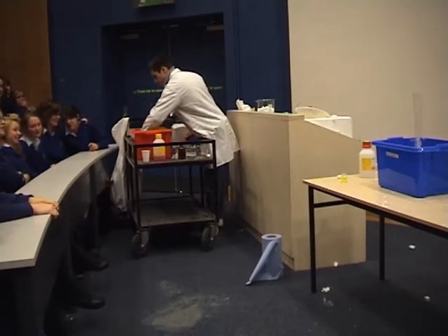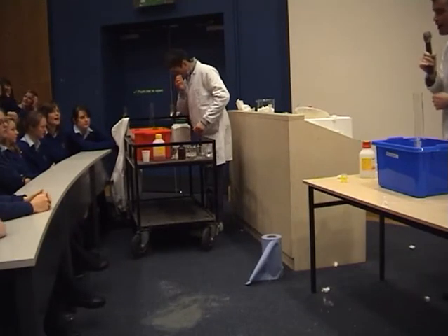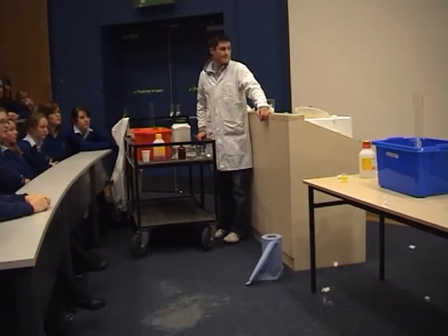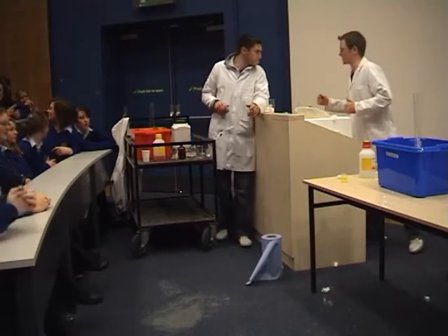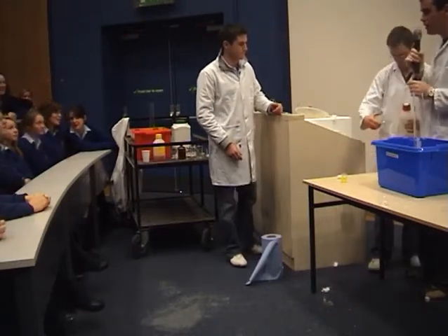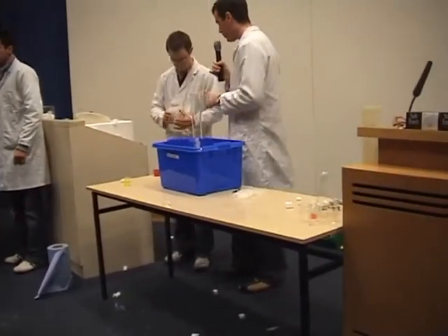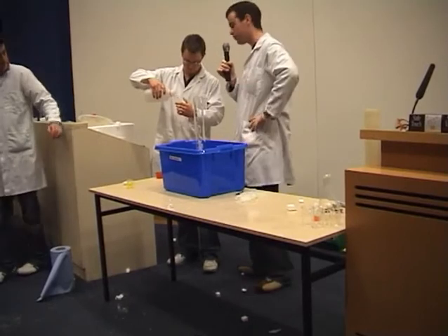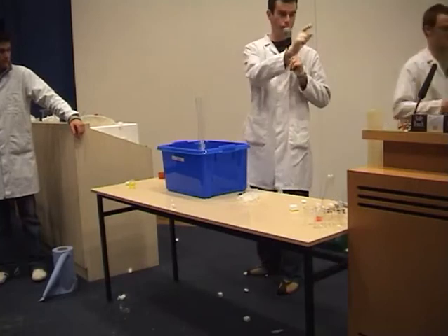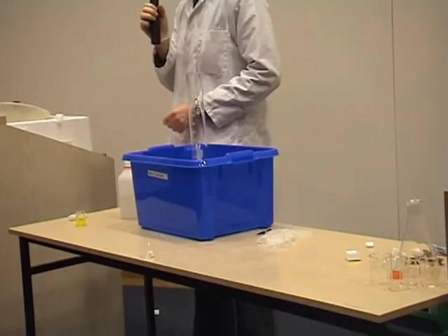Hello, guys. Today we're going to release some oxygen. That sounds a little boring, doesn't it? So we're going to make some toothpaste in the process, and not just any old toothpaste, we're going to make elephant toothpaste. What we have here is hydrogen peroxide. Colin is going to pour some of it in, John's going to pour some in his graduated cylinder, and I'm also going to pour it in my graduated cylinder.